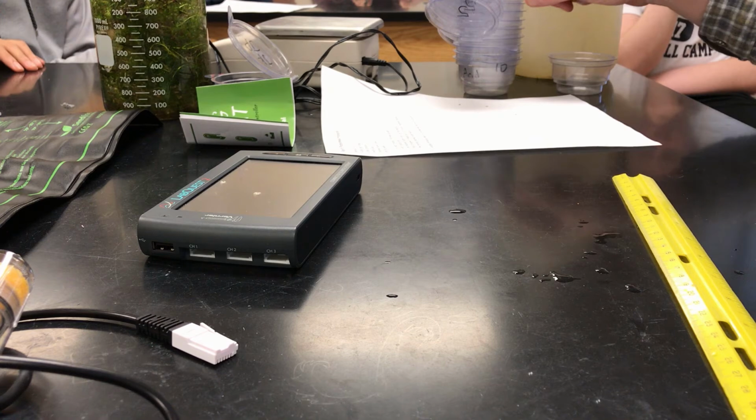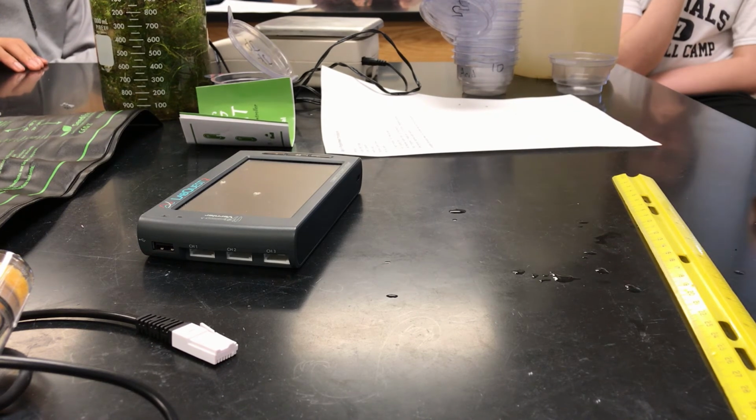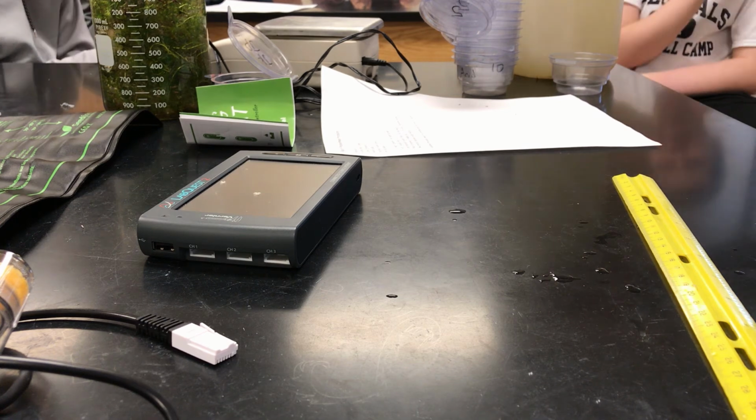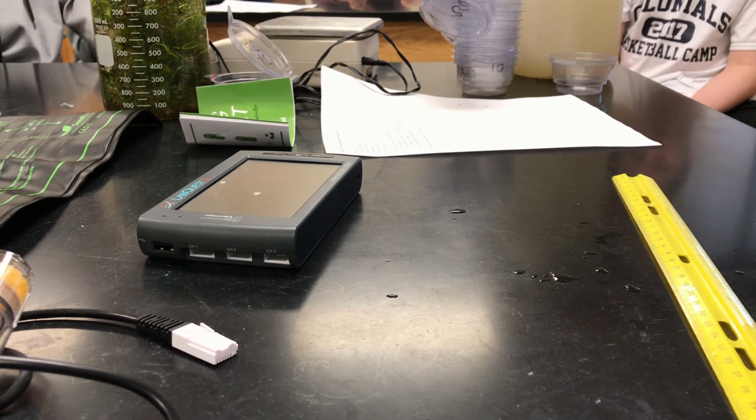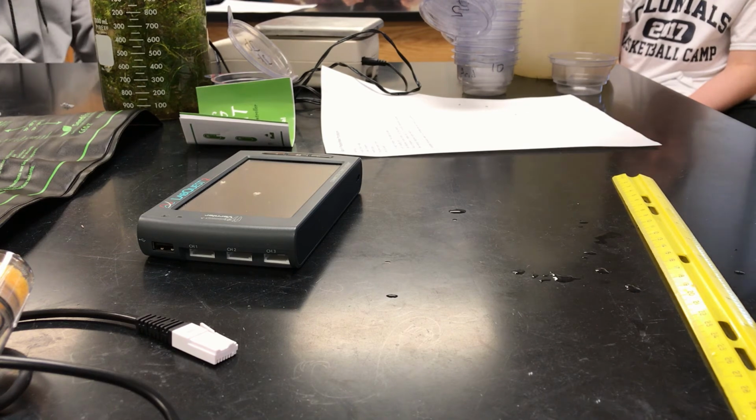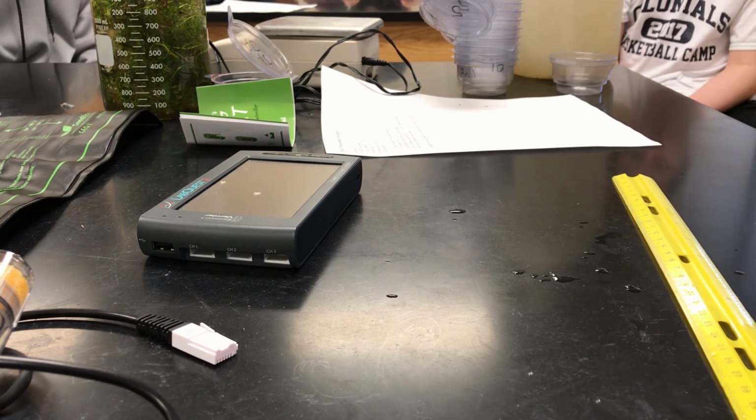And you'll notice these are not very big. I think these are 80 ml containers. So something like this, which is close to 4 liters, I think it's like 3 liters, 4 or 5 groups could easily set up all their containers with this right now.